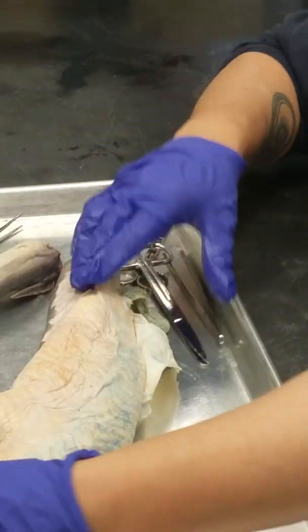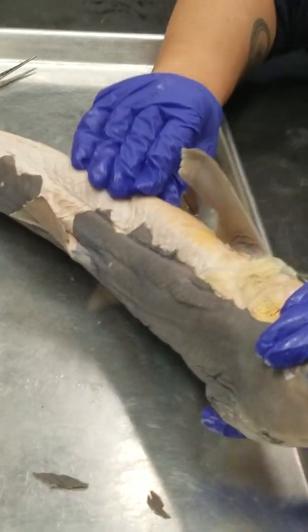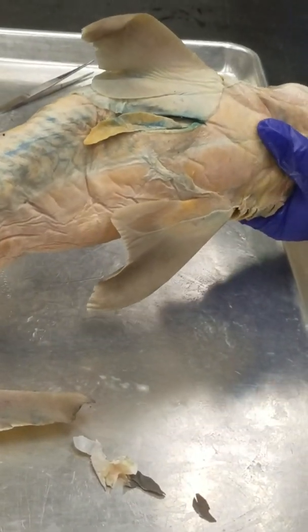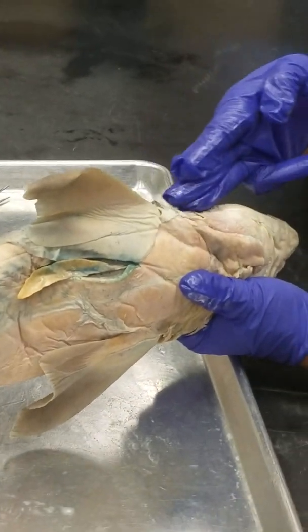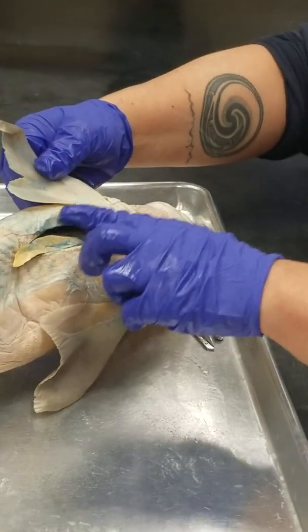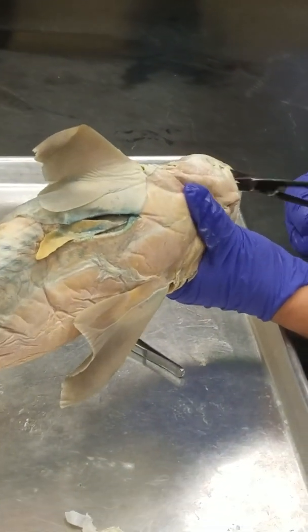Okay. So what we're going to do for this dissection is start cutting on the opposite side to what we skinned, because we made a lot of work trying to get these muscles. My incision is going to go from the corner of the mouth, straight through these gill openings, underneath my right pectoral fin, and all the way back to the cloaca. Hopefully these scissors are sharp.